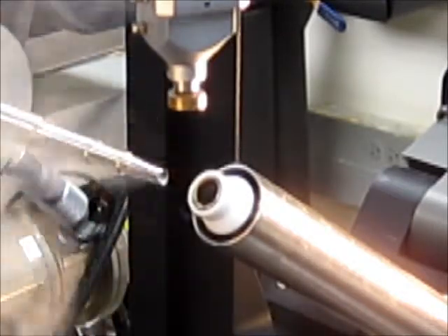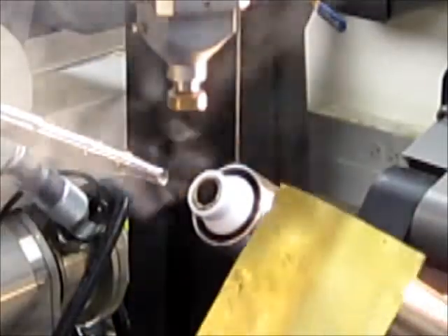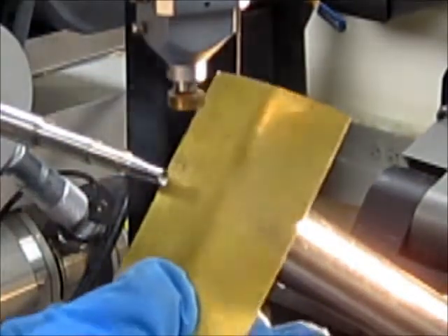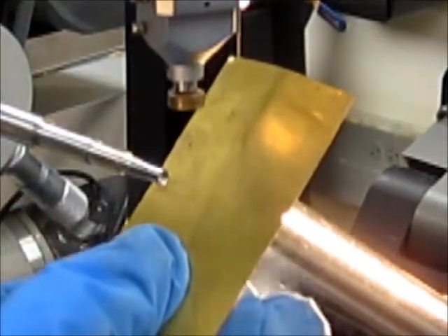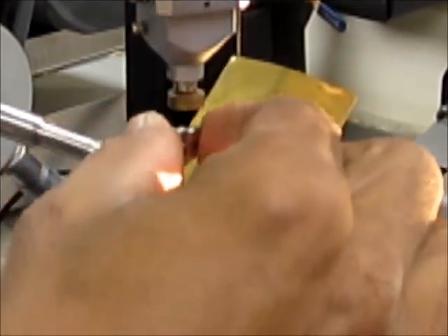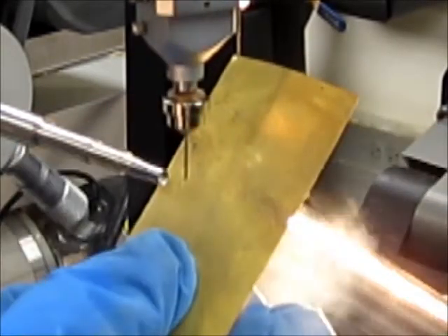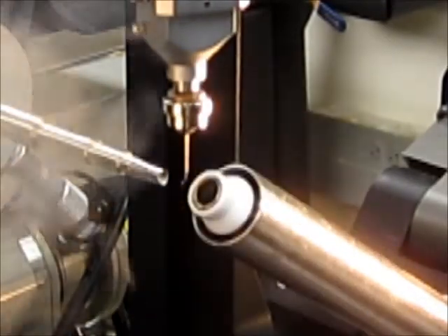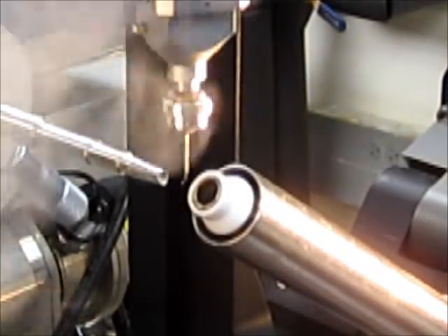Here comes the blocker. It is completely blocked. I am going to ensure that no stream is coming toward the goniometer. I am going to bring the crystal on my right hand side on a crystal cap magnetic and quickly remove and flash cool the crystal.